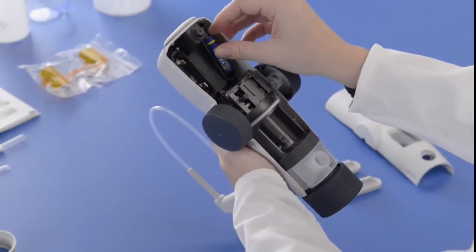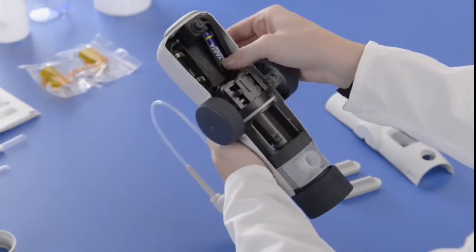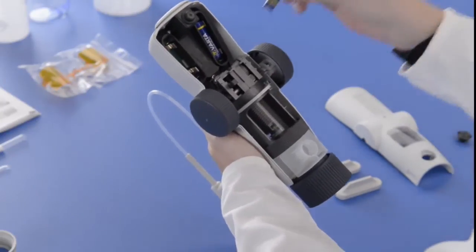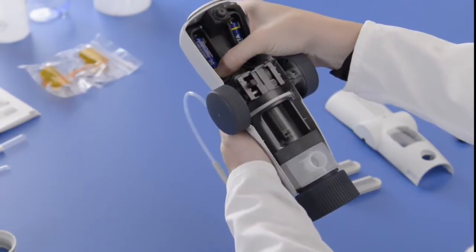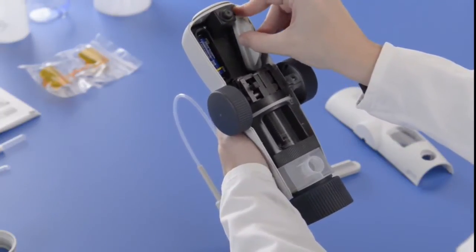Insert the batteries, making sure the positive and negative are properly oriented. Replace the covers and push them firmly in place.